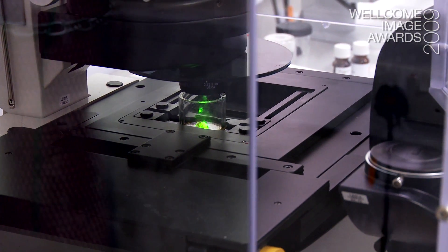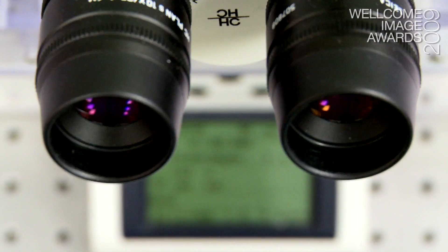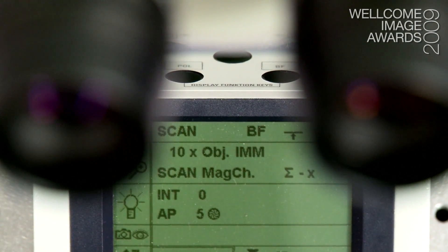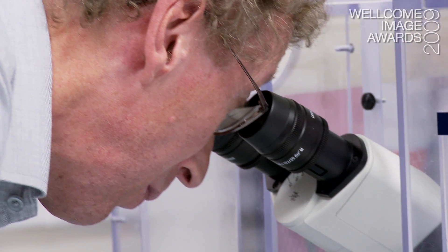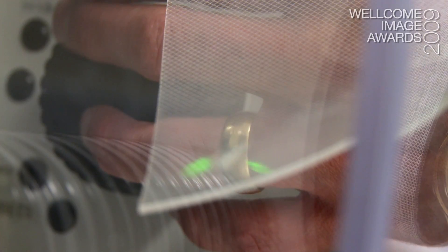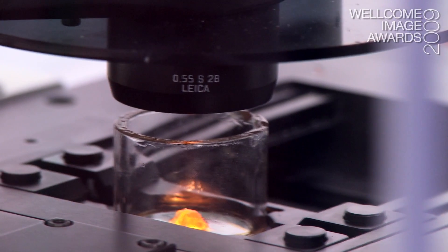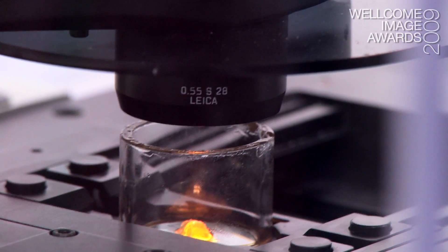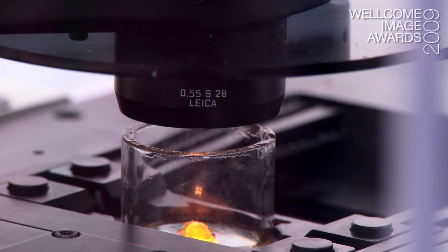With normal biological material, you can only go perhaps a hundred microns or so through on a conventional confocal. If you go into multiphoton, you can go further. Multiphoton microscopy uses lasers but it uses a red laser in the near-infrared — a longer wavelength laser. This gives the ability to penetrate deeper into tissue.